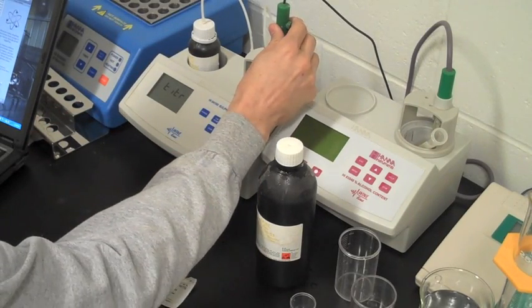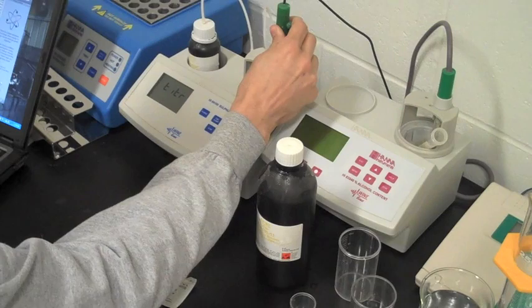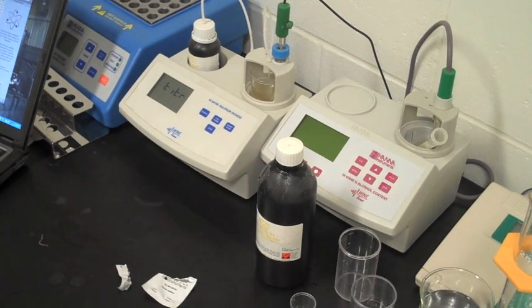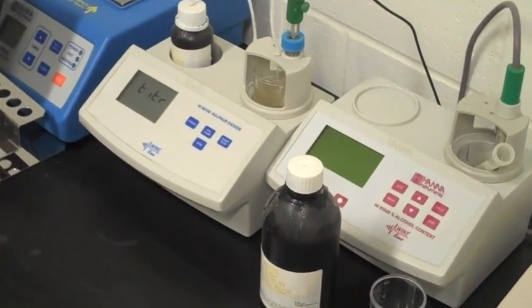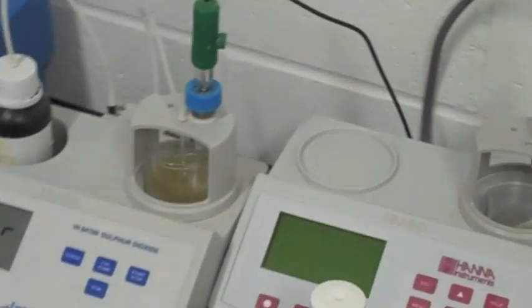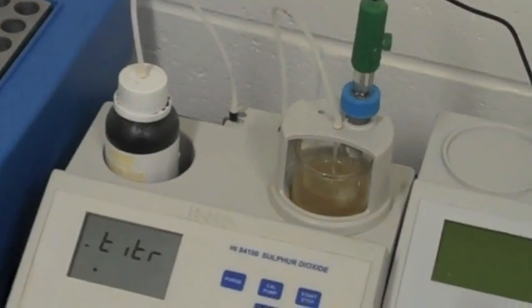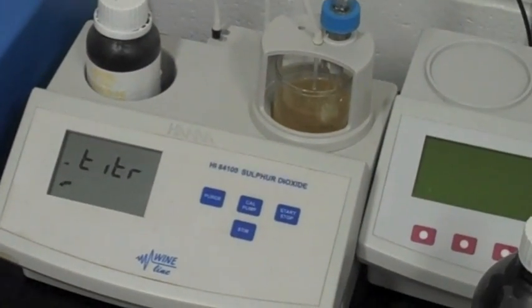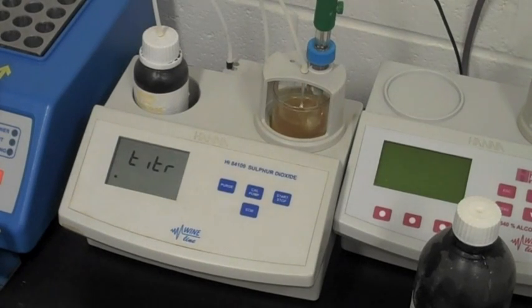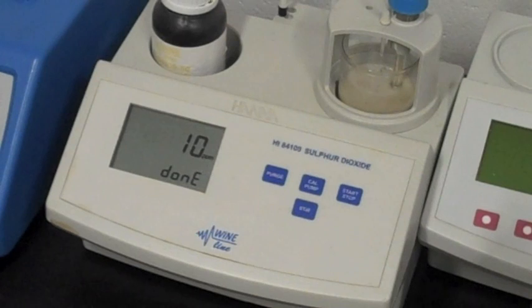And then you do the sulfur titration here. That's what it's at. 10 parts per million of free SO2.